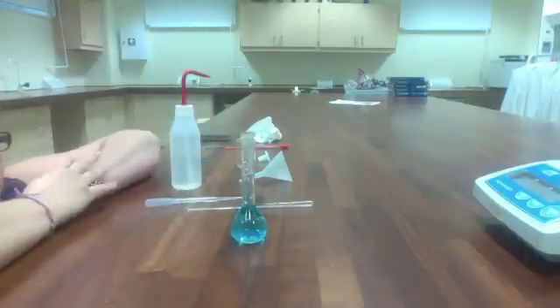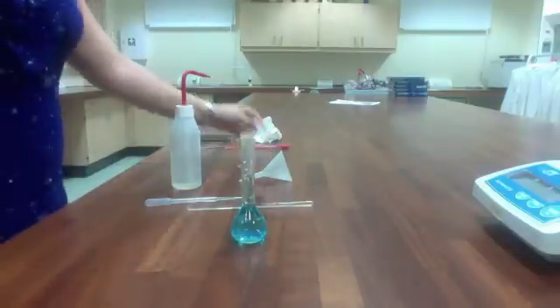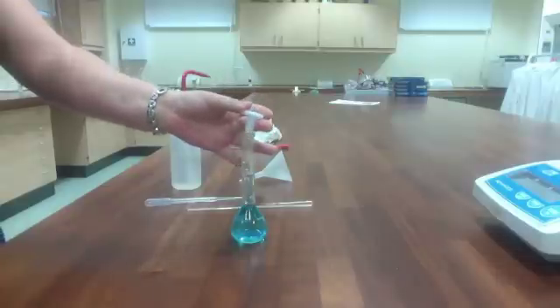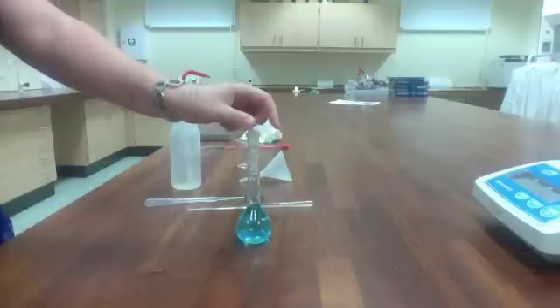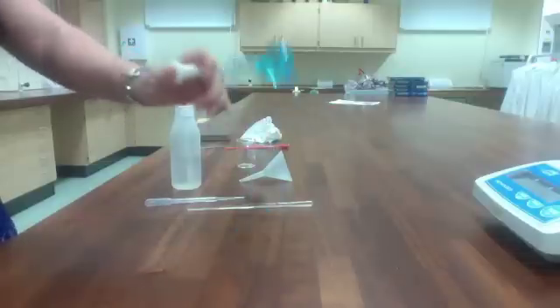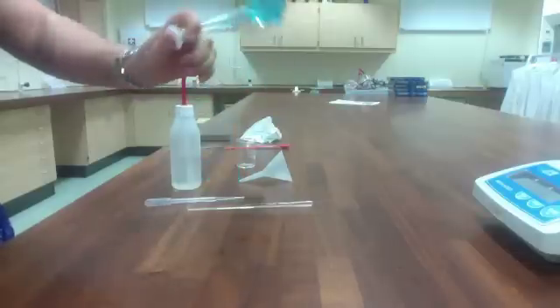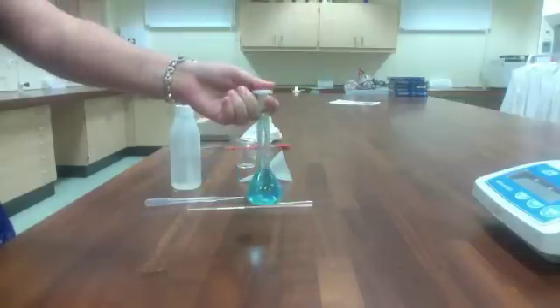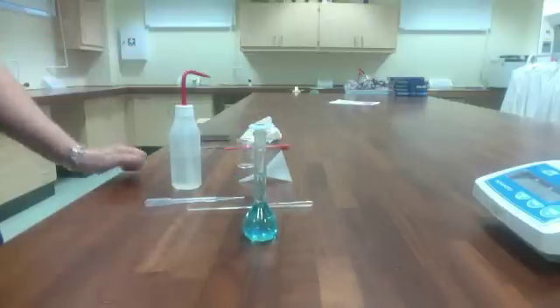And there we go. So my solution has been made up to the mark. The last thing I'm going to do to make sure that the number of moles of solute are spread evenly throughout the solution is put the cap on and then just invert it. We don't shake because that adds air and air bubbles. Invert it just gently a couple of times. And there you go. My solution has been made from a solid.